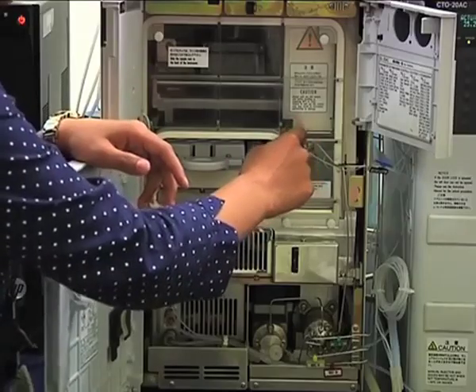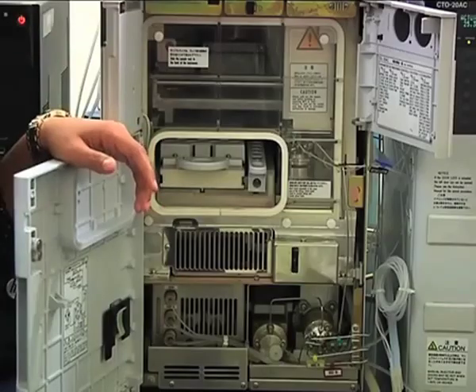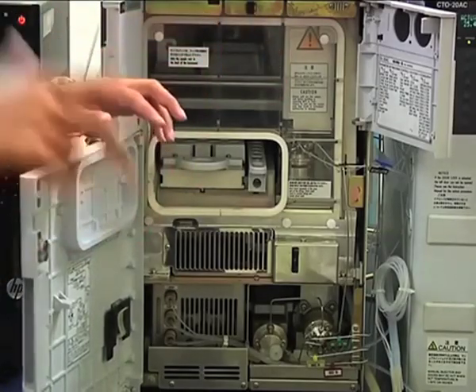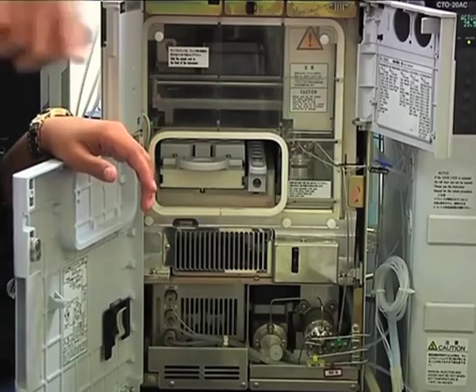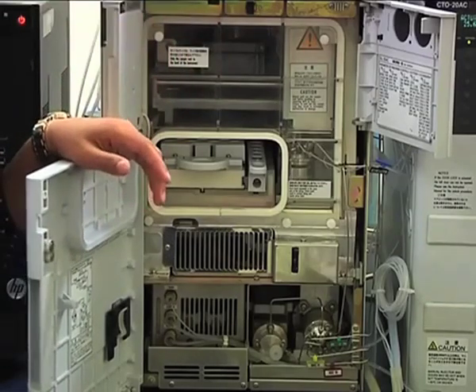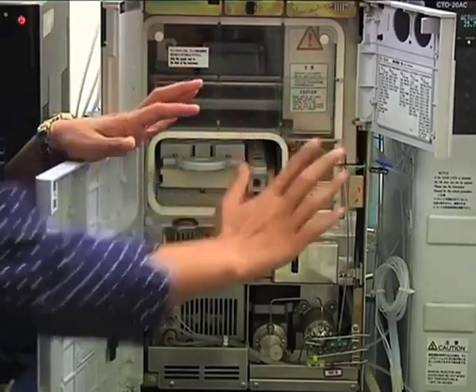Now the high pressure valve: your mobile phase will always pass through the high pressure valve, and there will be a sample loop attached also to the high pressure valve. So whenever you do injection, the mobile phase will switch and it will flow from the sample loop, it will collect the sample and then it will pass on to the column. So the mobile phase is always passing through this high pressure valve.